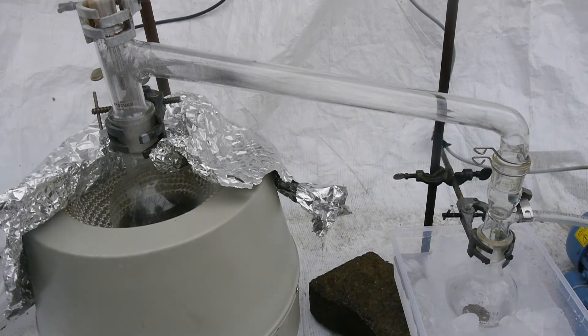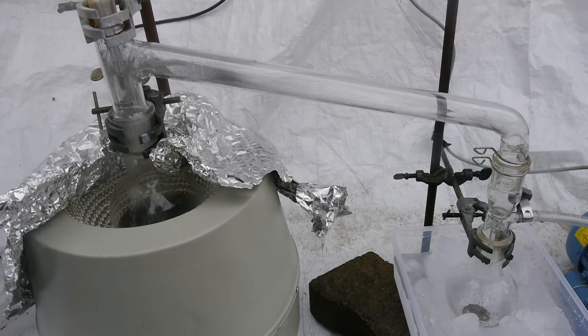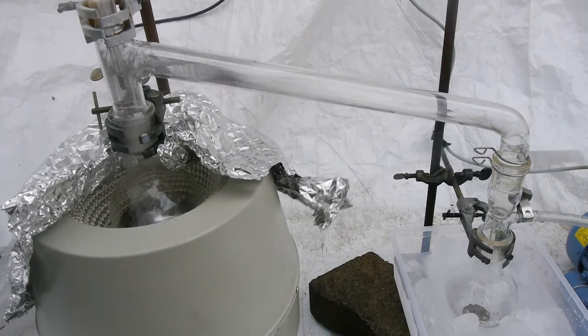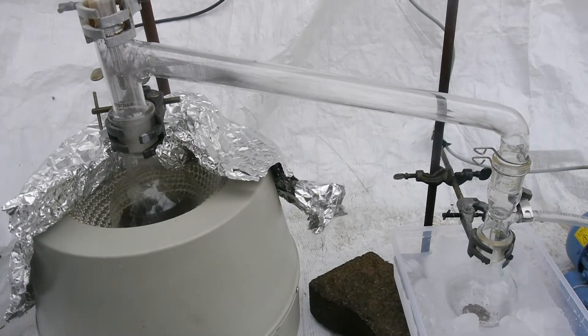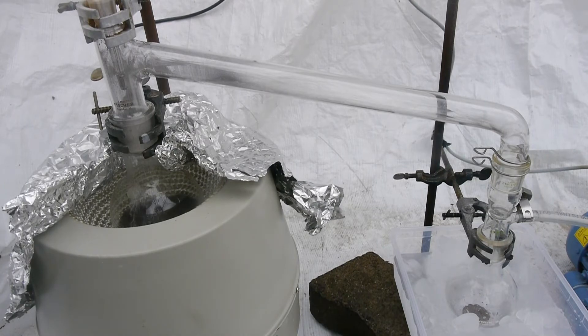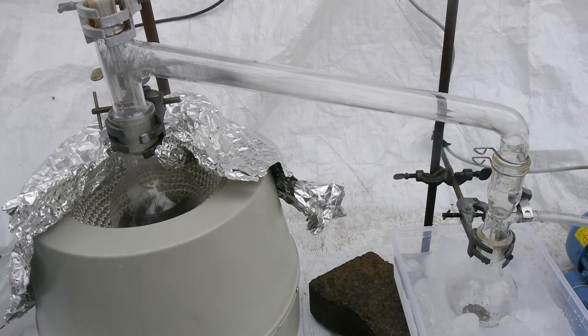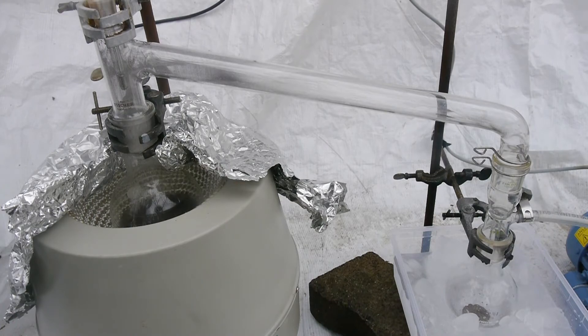Which is a lot more convenient temperature. Also, if the flask containing the boiling mercury pops, it will stop boiling immediately because of the rapid pressure rise. Which is very important for safety.